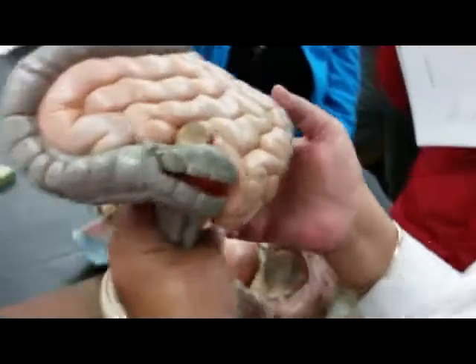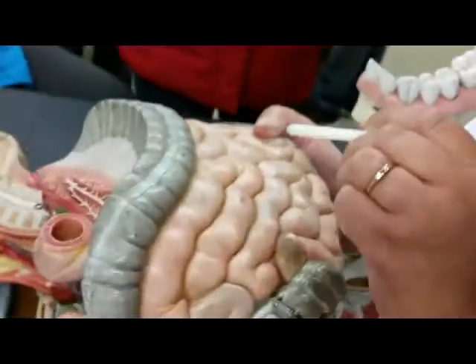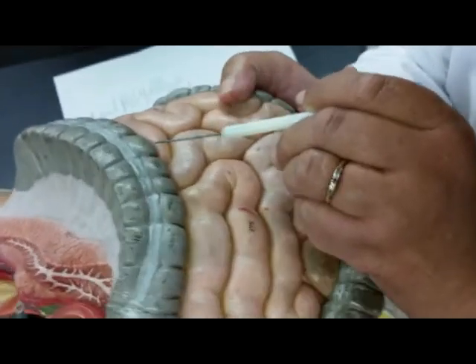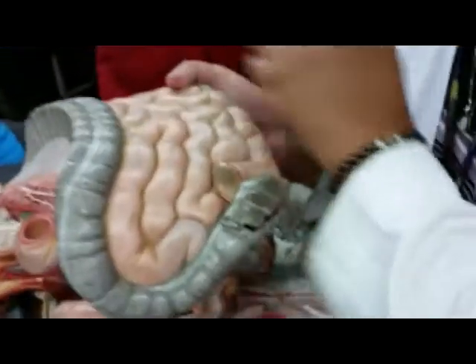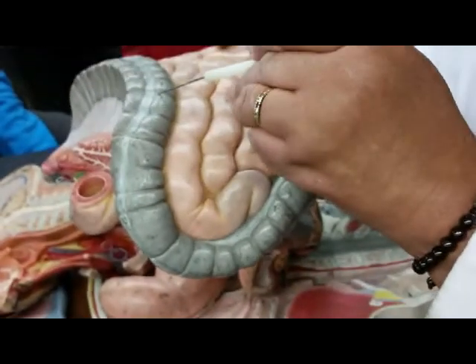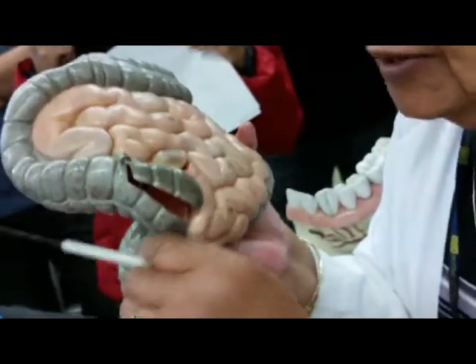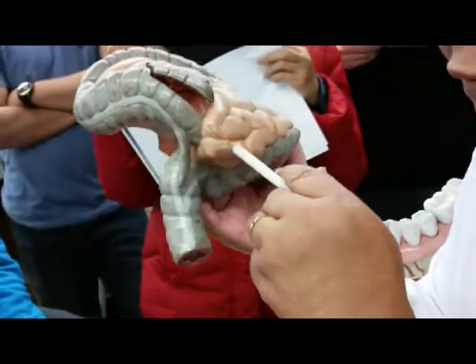So now the features of the large intestine. The pouches are called, they heard it today in the lecture, what is it? Haustra, or haustrum. And the band of connective tissue, that's the tenia coli. So you have it on your checklist, the tenia coli and the haustra. And by the way, this is the appendix, which has nothing to do with the digestive system. It just sticks out from the cecum.